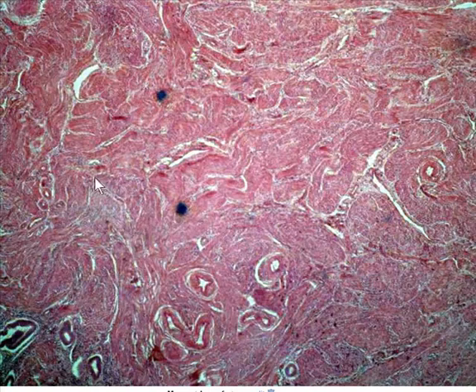And here's myometrium. Again, the only spaces you would see in here would be like blood vessels cutting through instead. So you need to identify two layers, endometrium and myometrium. You need to identify the uterine glands, and then you need to figure out whether it's in the proliferative phase or the secretory phase.